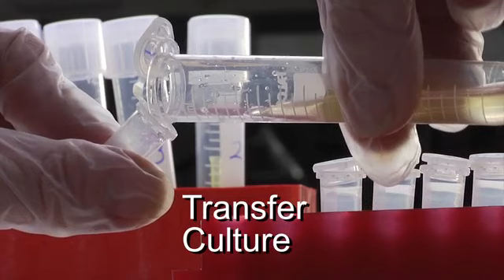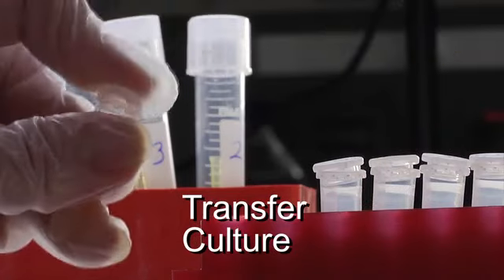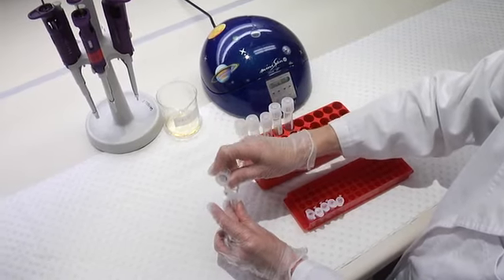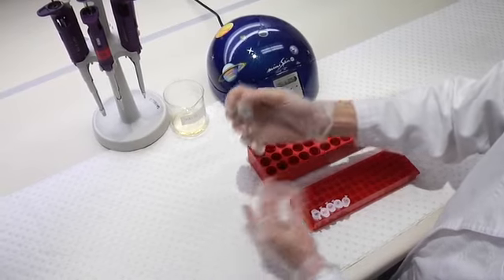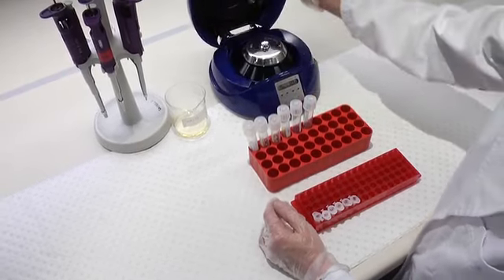To start, I transfer the culture to centrifuge tubes. And now we'll load them into the centrifuge.